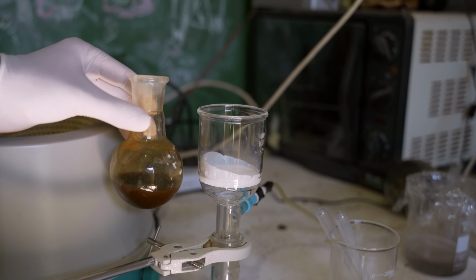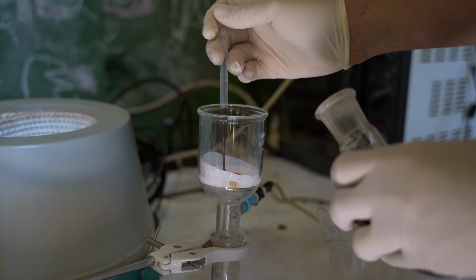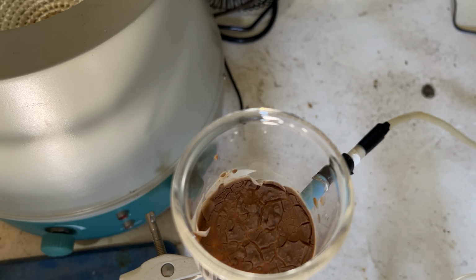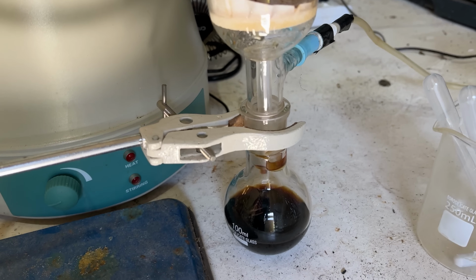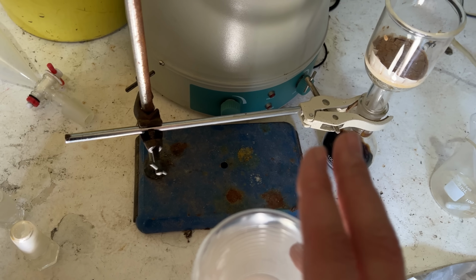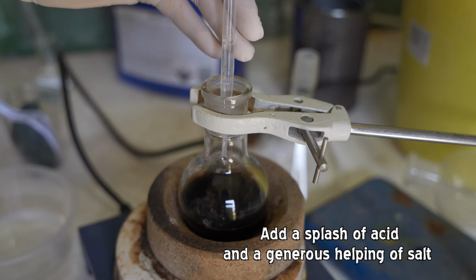Very tempting to be fooled here again, because this really looks like the precipitate, but this is what happened last time. There's our cubane. It's not in this. It looks like a lot of material, but it's not, and it's not the thing we want. I've got to convince myself of this. So this solution, we've now got to reacidify it. I'm also going to add in a lot of salt just to increase the polarity of the solution, so the cubane acid will more likely go into the ethyl acetate. I obviously stole this salt from the kitchen.